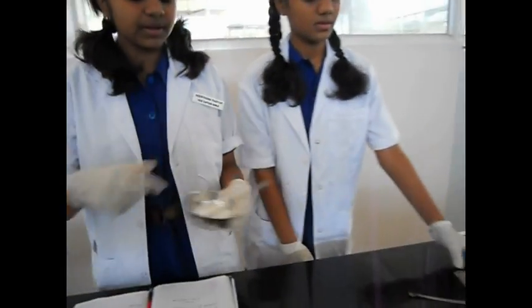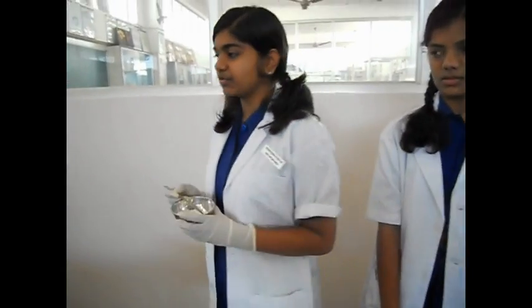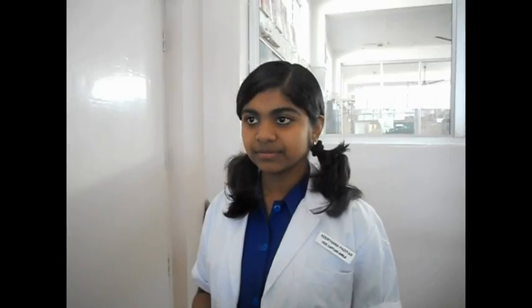Now let's take glucose in a spatula and weigh 5 grams of glucose. Now I am weighing 5 grams of glucose.